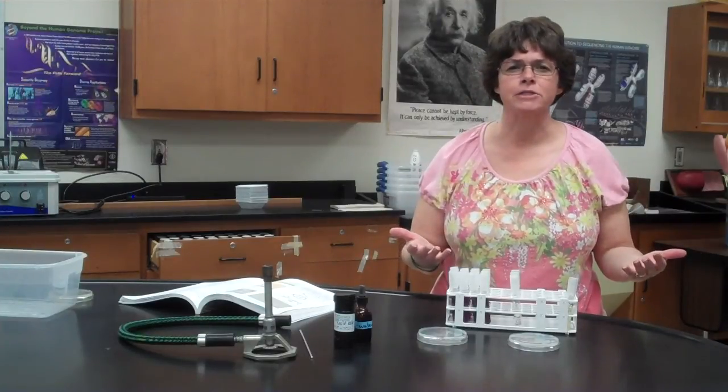Now with yeast, because they are eukaryotic, they're going to be larger than the bacteria. But growing on a plate, the colonies might look somewhat similar, probably a little bit bigger, but you're going to see the same round colonies that you might have seen with some of the bacterial species. But with these eukaryotic organisms, when we go to look at them under the microscope, you're never going to have to do any higher than 40 power or 40 objective because they're not small like bacteria, so you're not going to need the oil immersion.